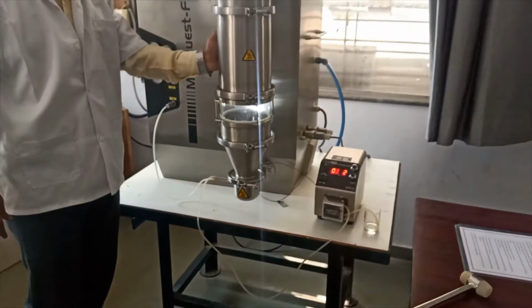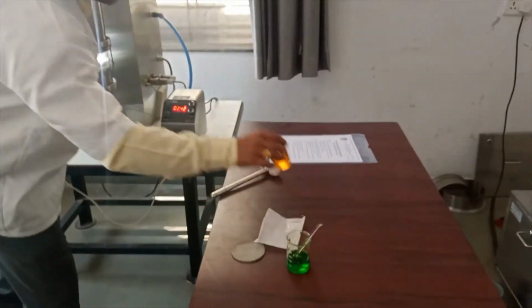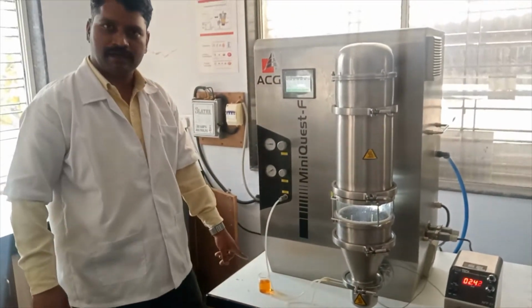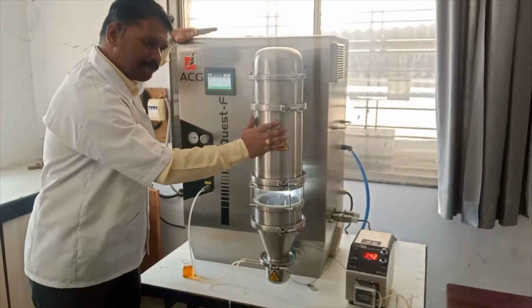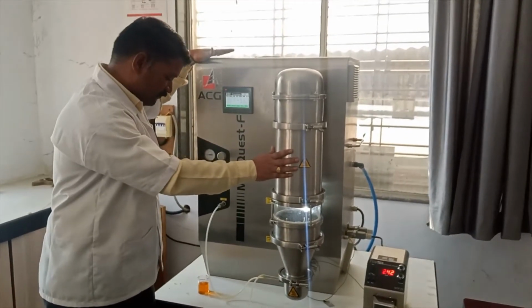After that, drug coating, drug layering, and then polymer coating. The first step is a seal coating using HPMC E5.